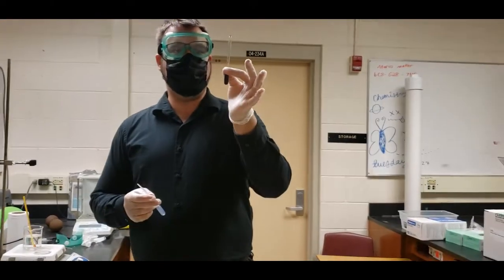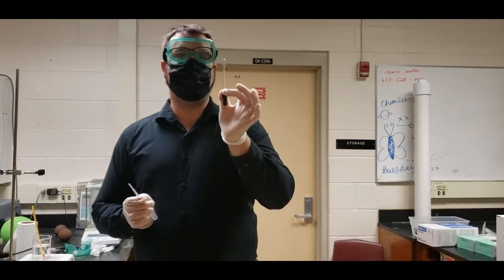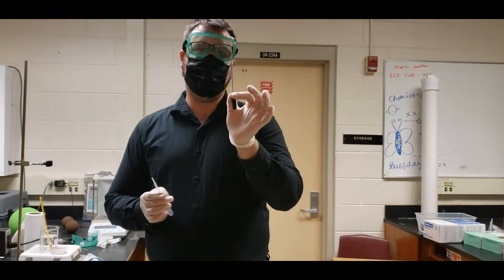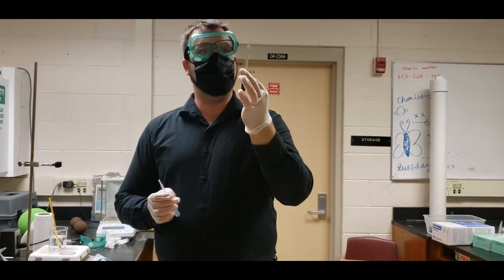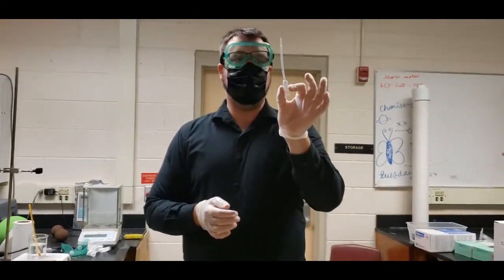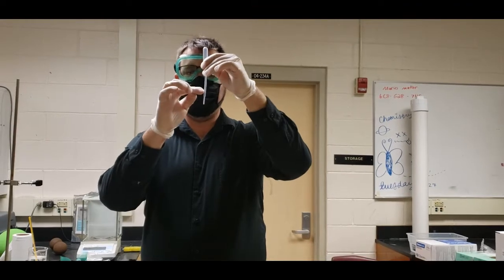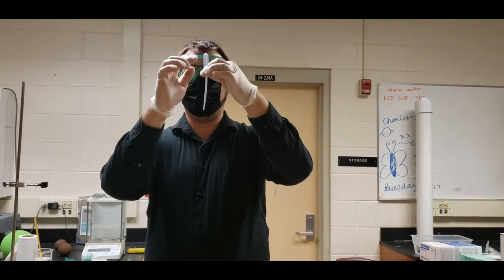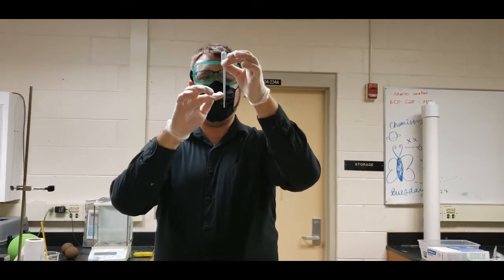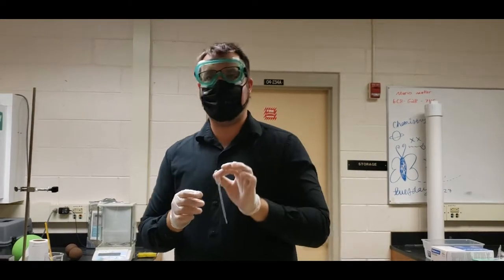We are going to have 2 pipettes that we are going to use. This glass pipette is used for giving only drops of acid. It is used for when you have to use really strong concentrated acid. Since we are working with 18 molar sulfuric acid, we are going to be using this for that. And then we have a barrel type graduated pipette where each line on it tells us how many milliliters we are using. This is useful if we have to add 2 milliliters. This is what we are going to use to add our acetic anhydride.